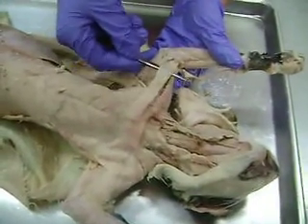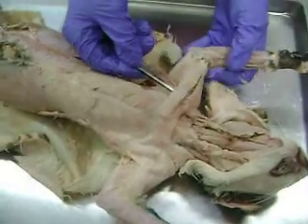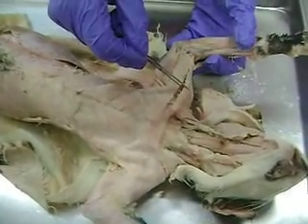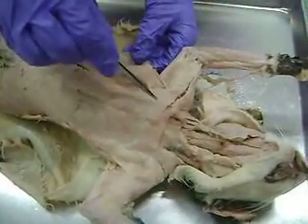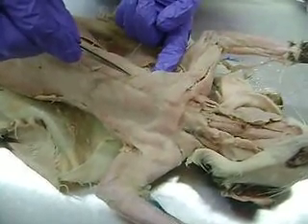The muscle that looks like a band here, lying over the top, is the pectoantibrachialis. The one right above it, right here, is clavodeltoid. And then as we move down past the pectoantibrachialis, this muscle here is pectoralis major.